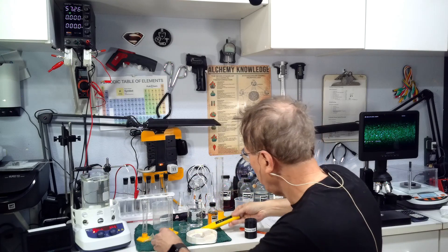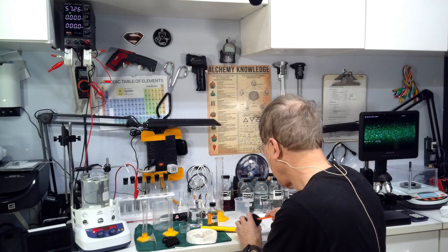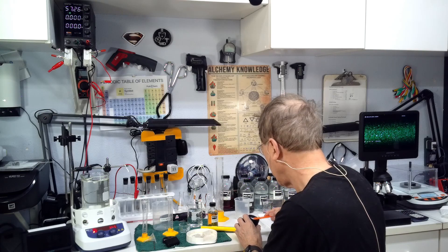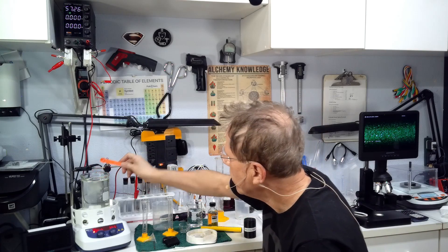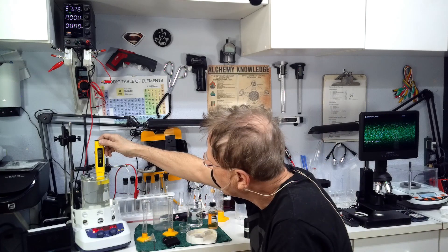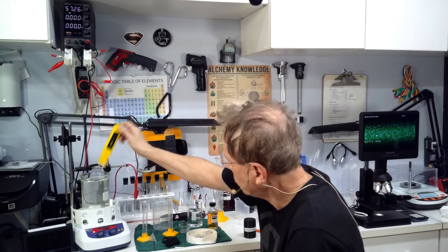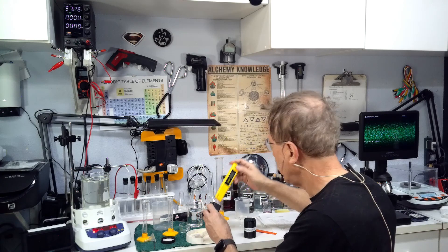Take our pH meter and we want a pH of at least 10.5. We got 10.38, it's a little low. We're going to take another eighth of a teaspoon of washing soda and add that. Looks like we hit 10.53, that's actually fine.